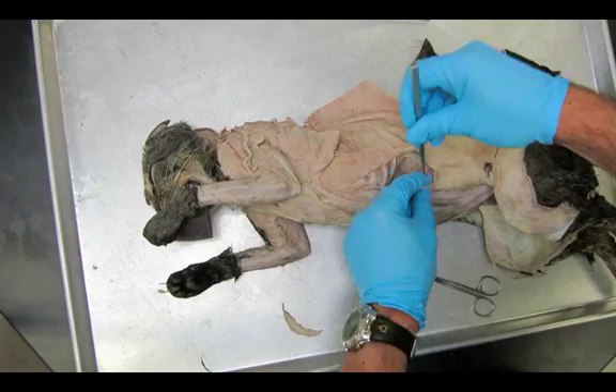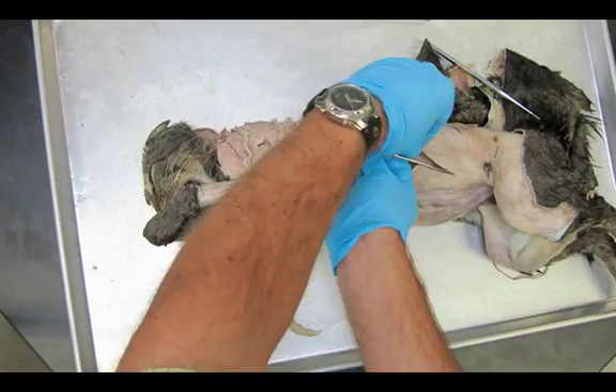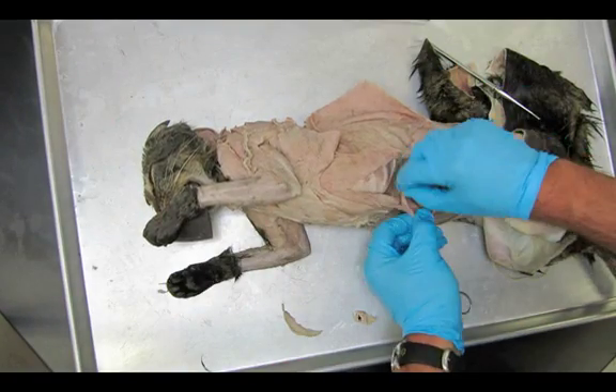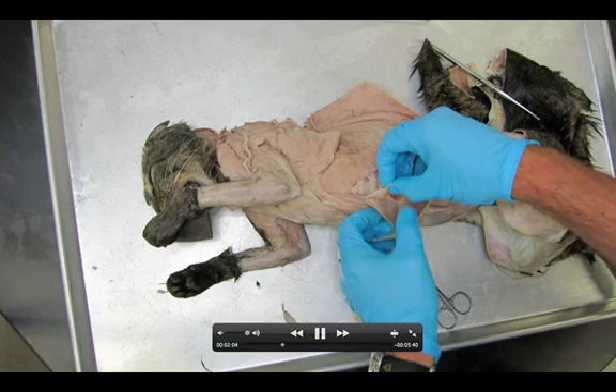Now you're actually starting to see the internal oblique underneath. So long as you started over the ribs, you should have no problem — you should not be surprised with any intestines peeking up at you. This muscle is the external oblique. The internal oblique is what you're going to see underneath. And now we're going to be seeing this muscle running along the abs, or what we call the rectus abdominis, which is why it's called your abs. So you're going to see how I peel the rectus abdominis off of the external oblique.